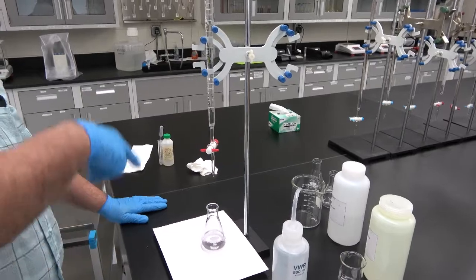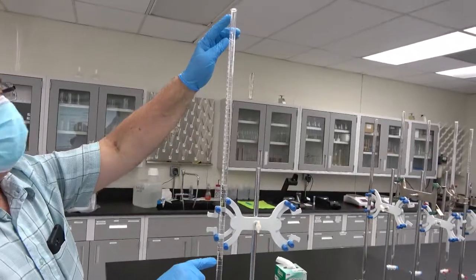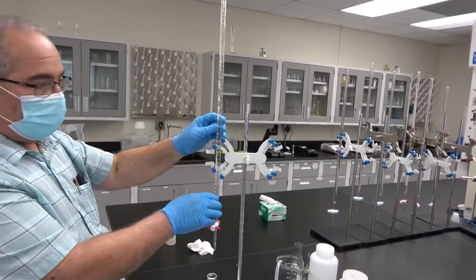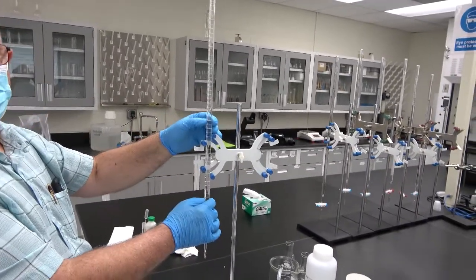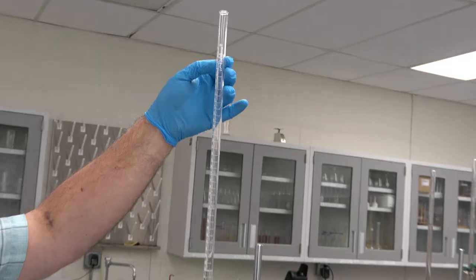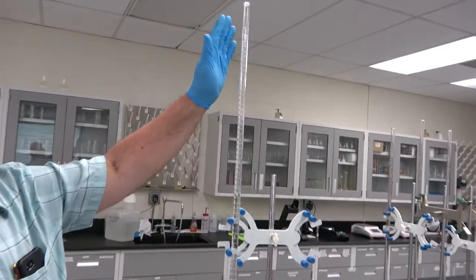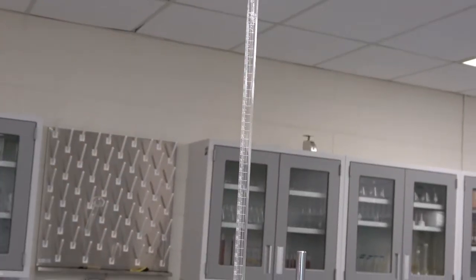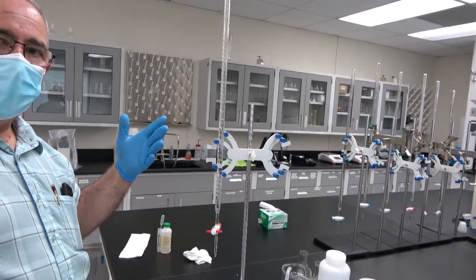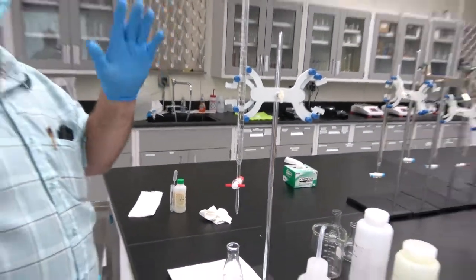Next, we are going to fill up the burette again up to the 0 mark, because as you see, this is a 50 milliliter burette. If we try to do a titration with whatever is left here, we're going to need 30 milliliters and we only have 20 milliliters left. So at this point, it's a good idea to fill up the burette again up to the 0 mark. After we have the burette filled up again, we're going to do another titration. And we're going to repeat the same procedure that we already went through in trial 1. And that's going to be done 2 more times. So at the end, we're going to have 3 trials.